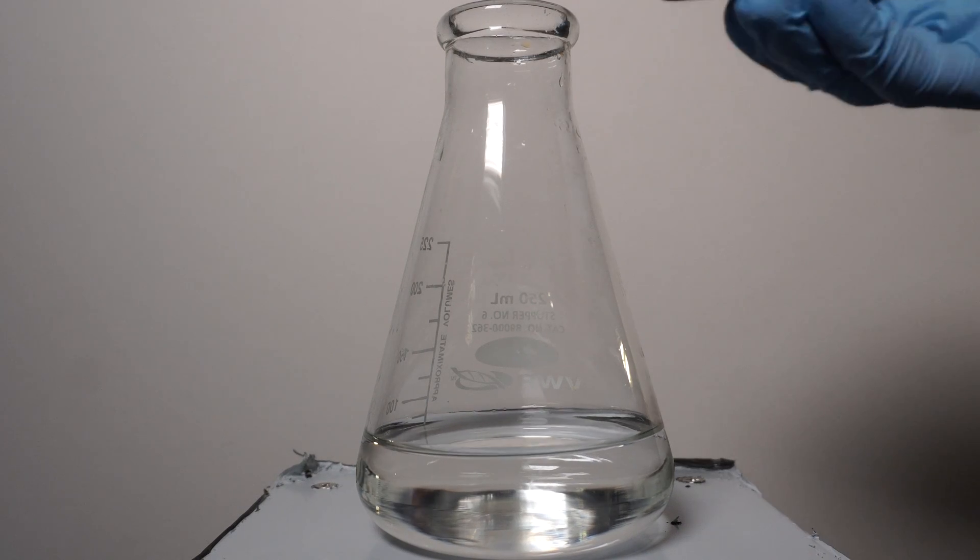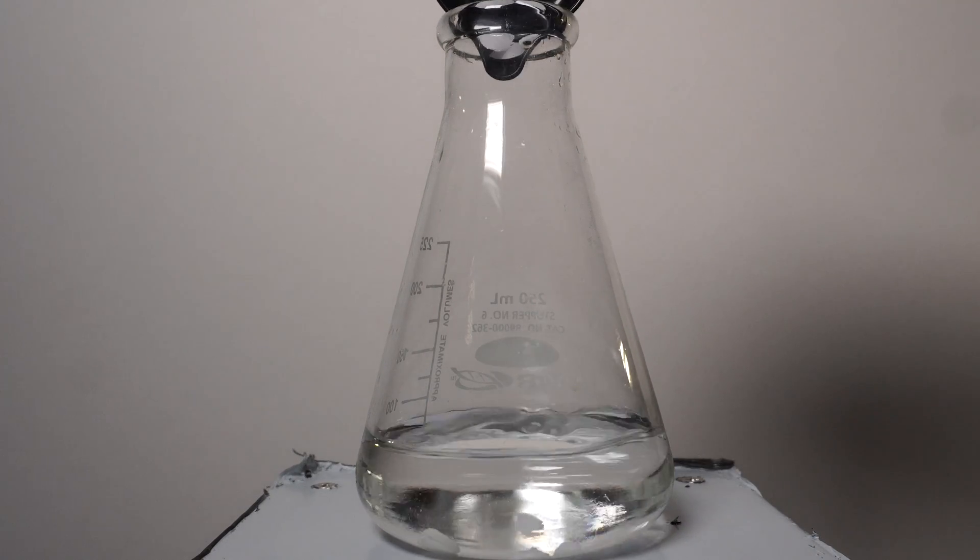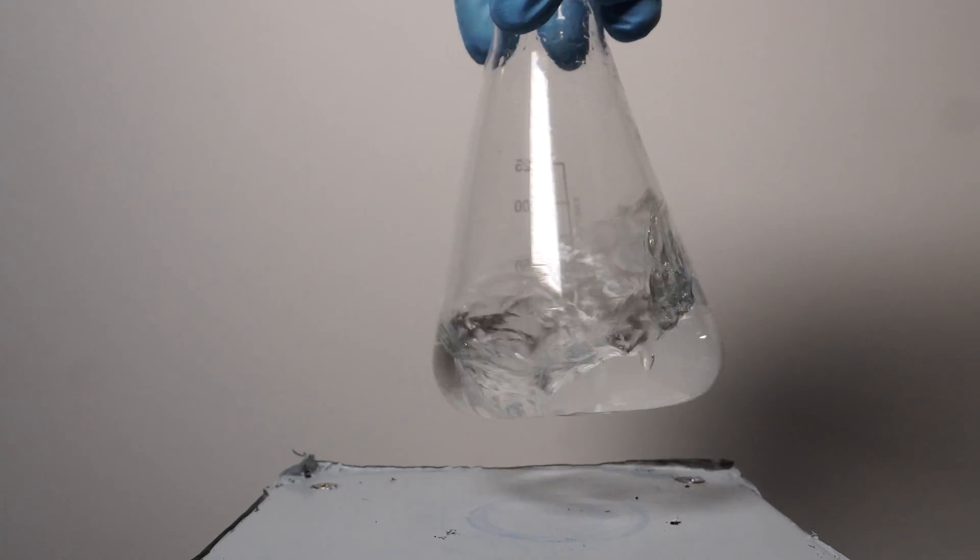This time, however, we will add the potassium hydroxide, let that dissolve completely, followed by adding in the methylene blue.